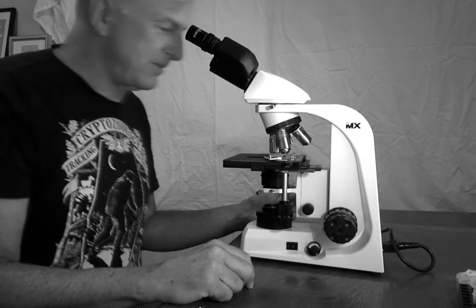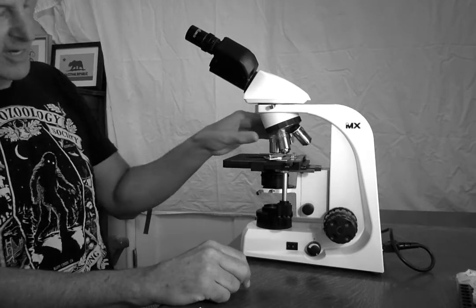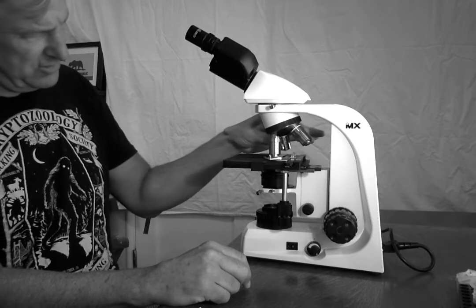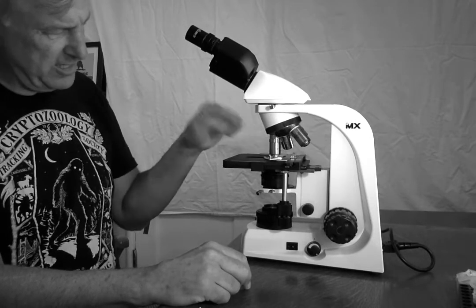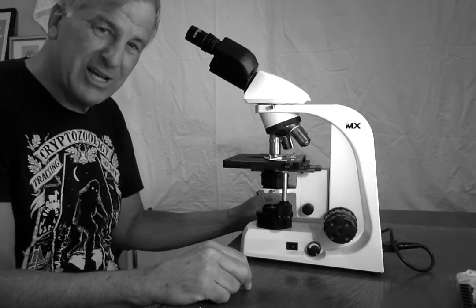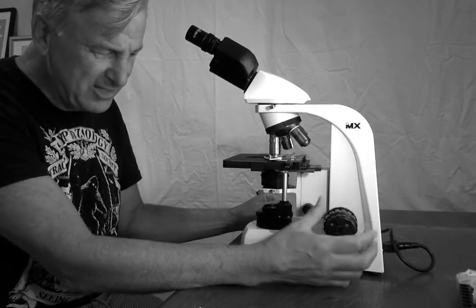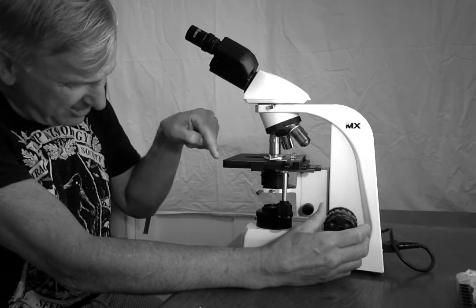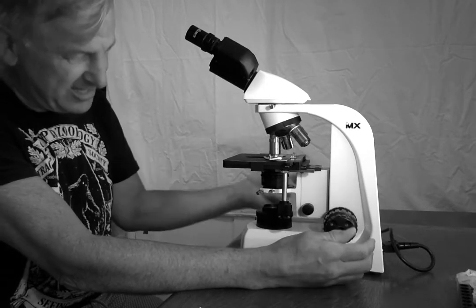And I think, well, what about the next? Let's go to a higher magnification. Let's go to the 40x objective, which as you can see is almost touching the glass. So that's why it's dangerous to move the coarse adjustment, because I could jam this lens into the glass and damage it.